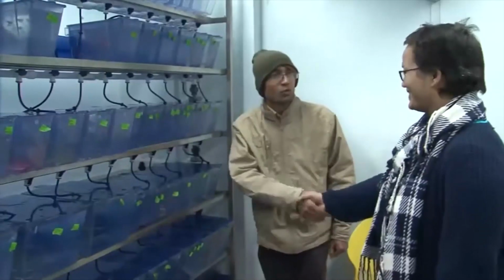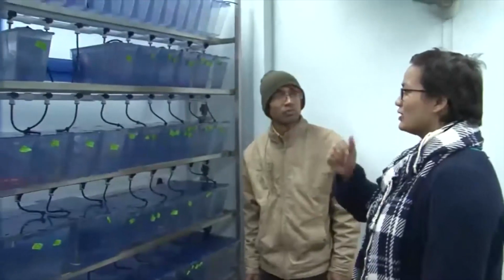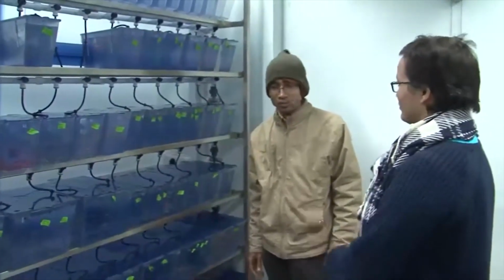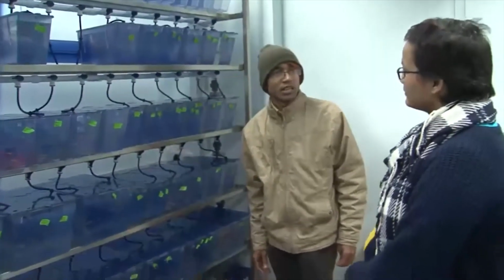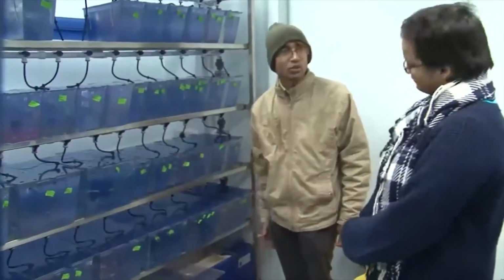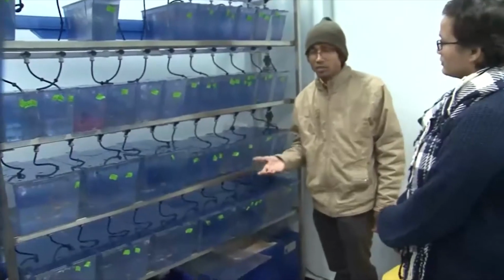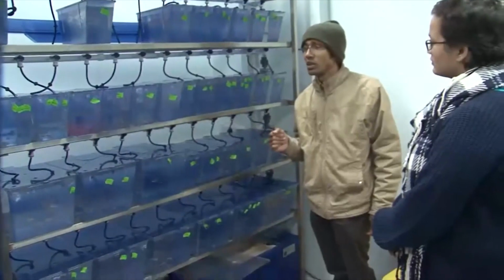Hi Nilesh. Hello. So with respect to functional genomics, in this model fish, how do you maintain this fish model, and how do you edit the genome of this fish? For editing genomes, there are various technologies, and the most recent one is CRISPR-Cas. That can be used in live fish. It has already been optimized for fish systems. There are knockdown methods. Then there are Tol2 transposon-based methods available.